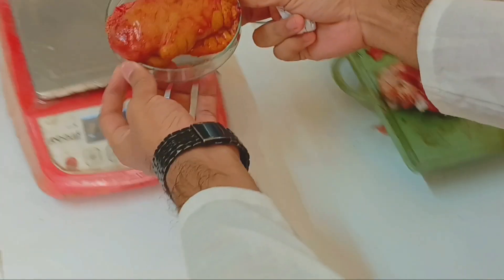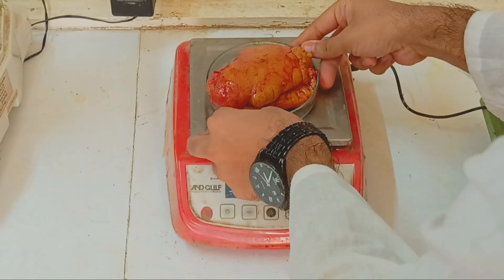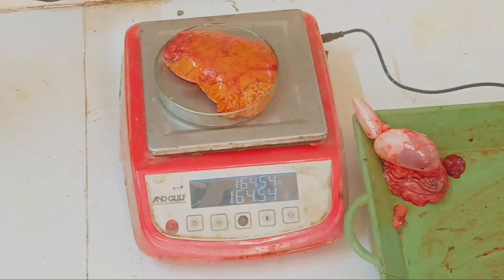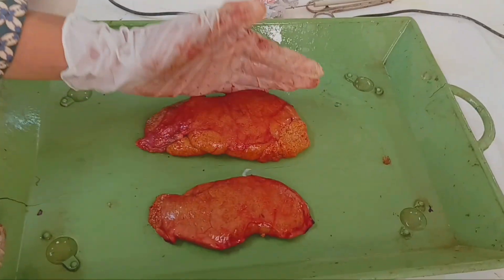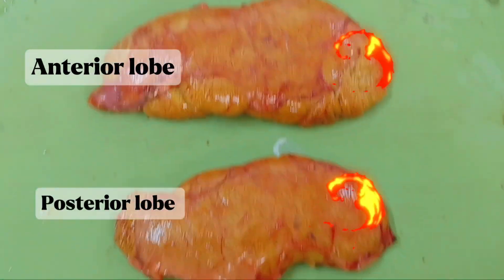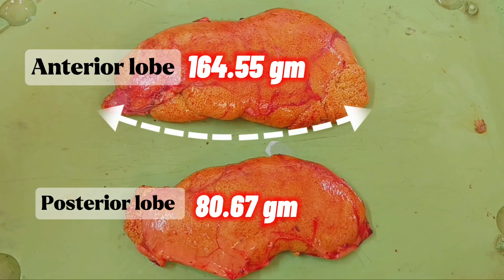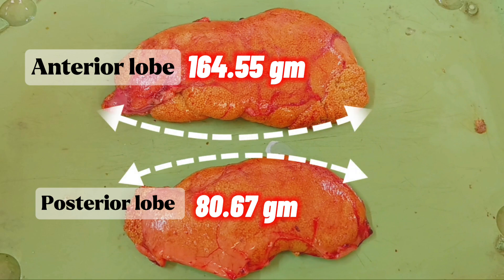Next, we weighed the total ovary mass using an analytical balance. After that, the two lobes of the ovary were separated and weighed individually. We observed that the anterior lobe was larger in size and weight compared to the posterior lobe.